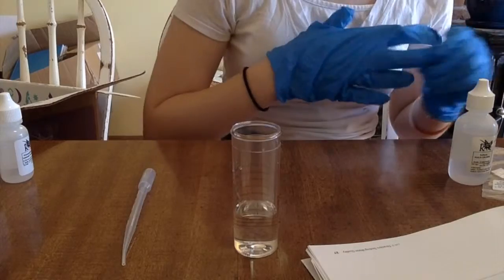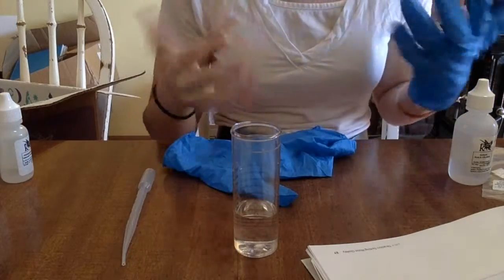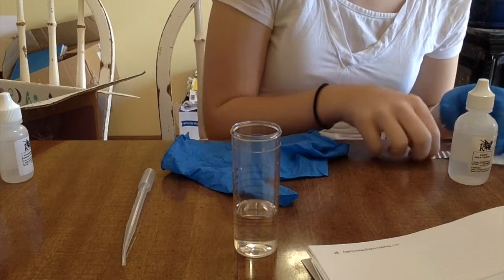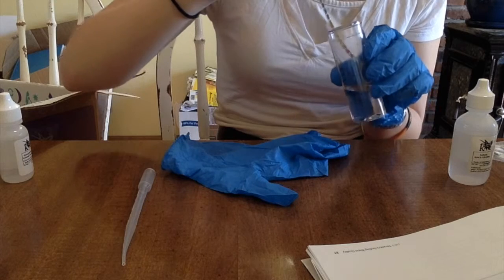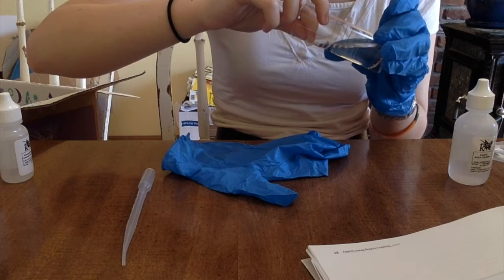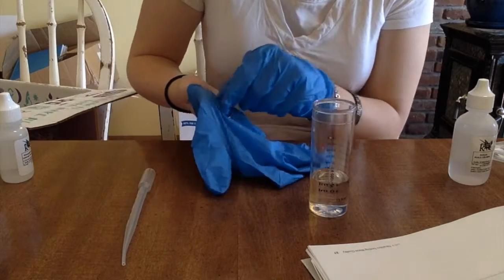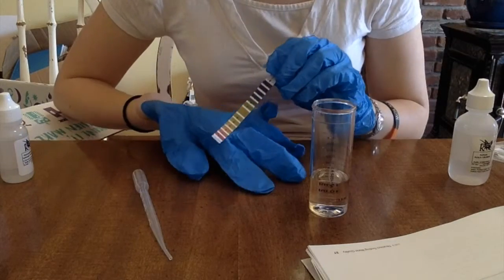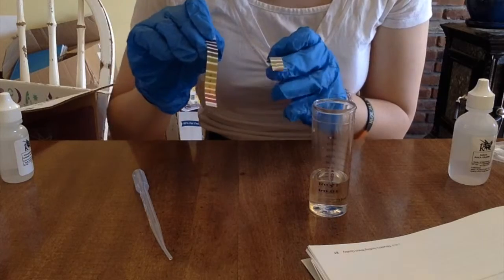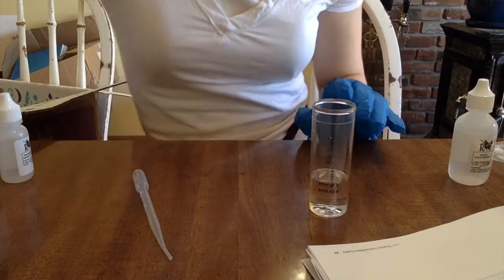Next step is to make sure that this is actually approximately 8.3. It's wet inside my gloves too — this is why you don't wash your disposable gloves, people. We need it to be 8.3. I'm gonna just hold it up. Yeah, that is pretty much the same color as my last strip. These are both supposed to be 8.3. That's about the same color. I think it's good. It's clear.